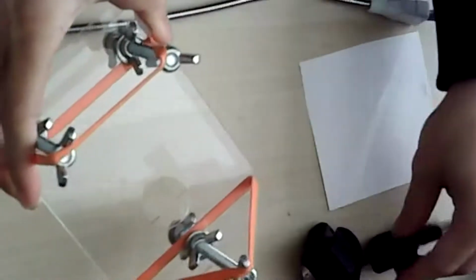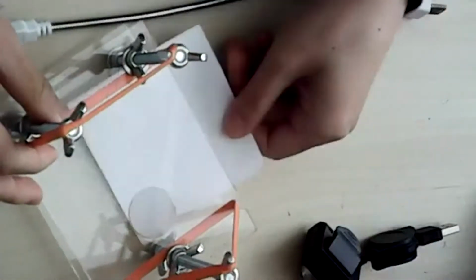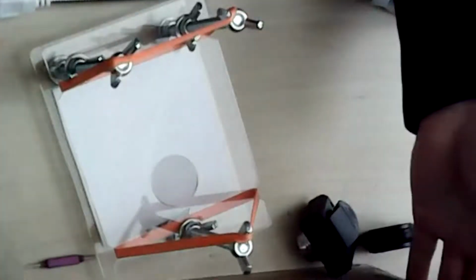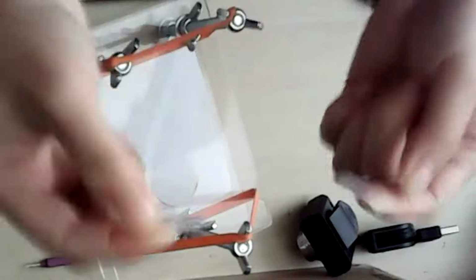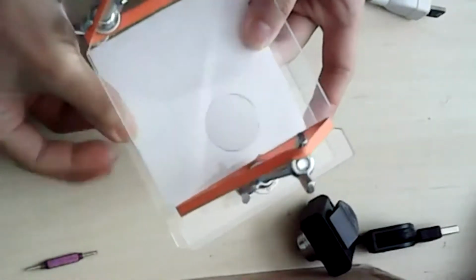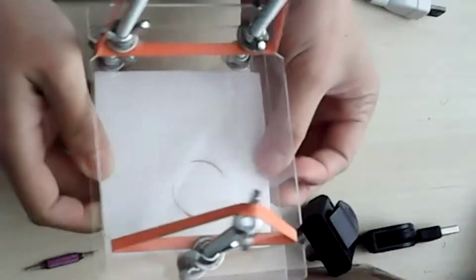And to do the last part of the stage, all you need is a piece of, I just use printer paper. You can use a Post-it note or anything you want, just a white piece of paper, and you can put it on the bottom. And then probably best to just secure it with some tape. A little bit of tape here. And if there are questions, feel free to interrupt me as we go.